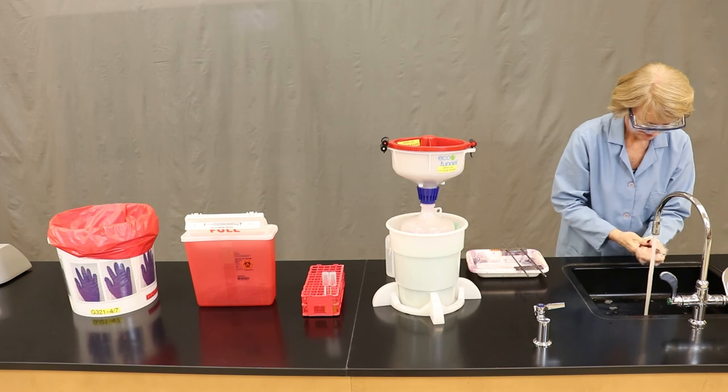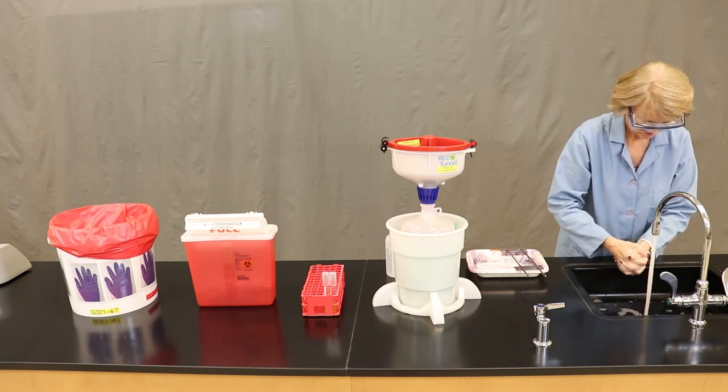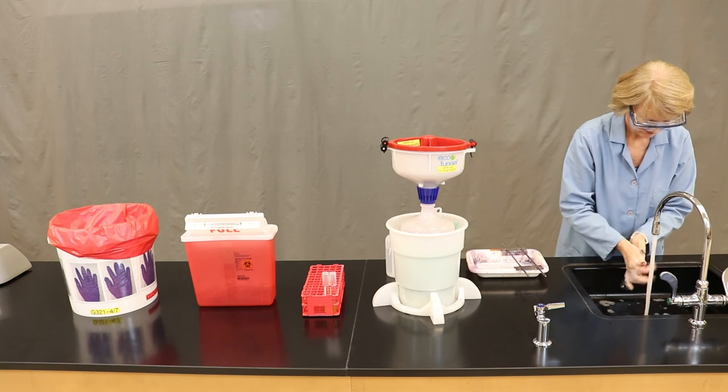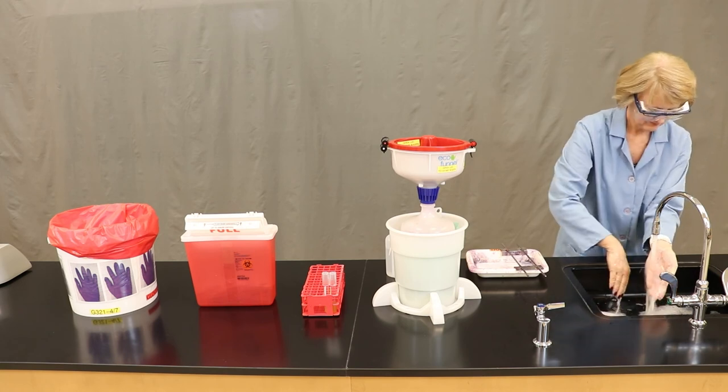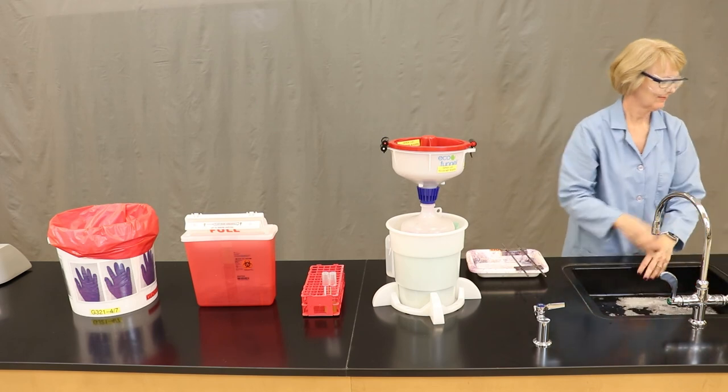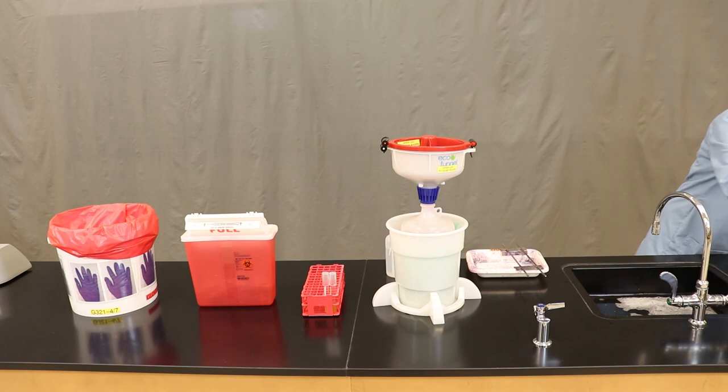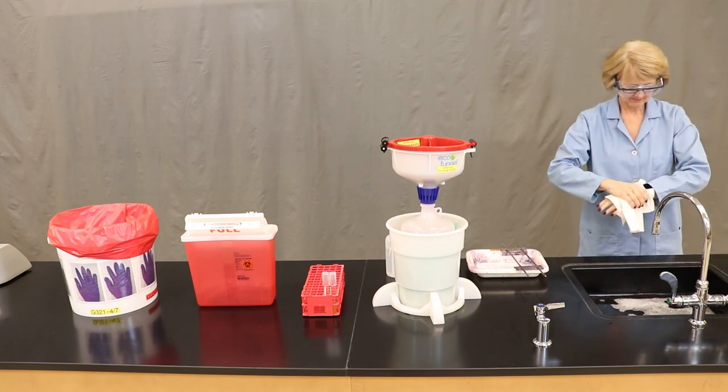Wash your hands by using soap and water for 20 to 30 seconds. Get in between your fingers, under your fingernails, and rinse down the drain. Paper toweling is advised. Be sure to throw these paper towels away in the regular garbage.